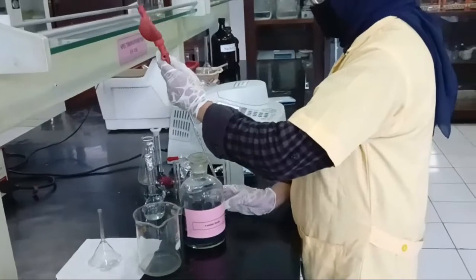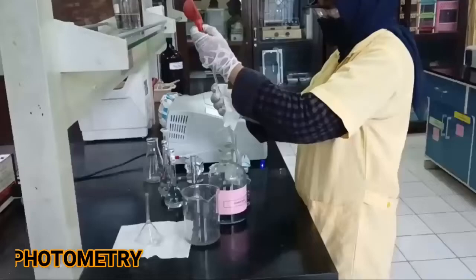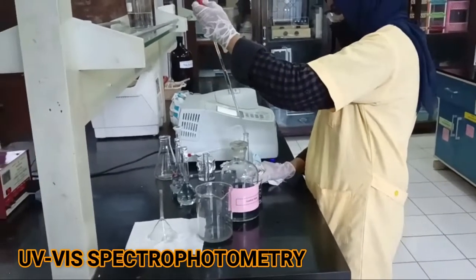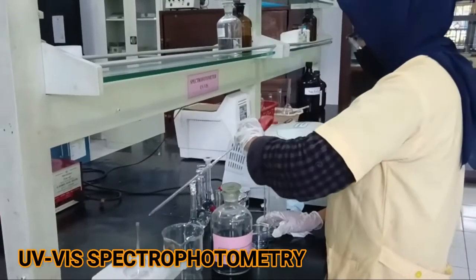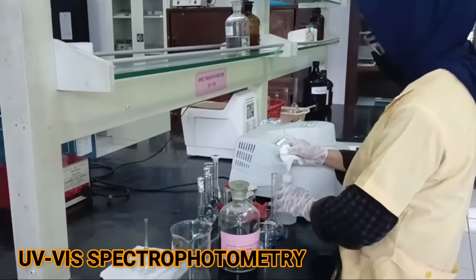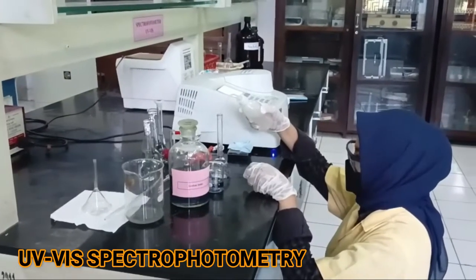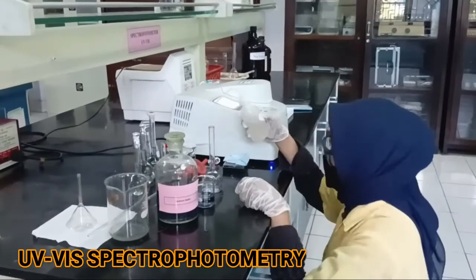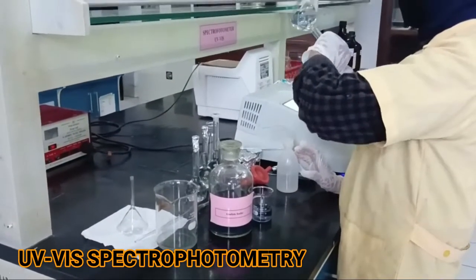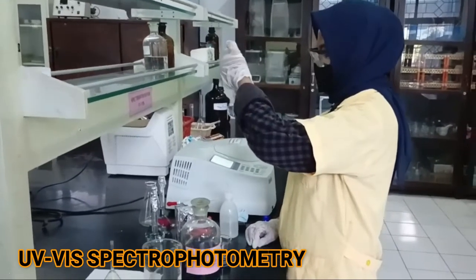Students are expected to know how to apply the spectrometry method to determine the concentration of an analyte. In this experiment, students are trained to use the UV-VIS spectrophotometer. They need to know how to prepare samples, make standard solutions, determine the maximum wavelength to be used in determining the analyte, create the calibration curves, and then use the curve equation to determine the analyte concentrations from the sample.